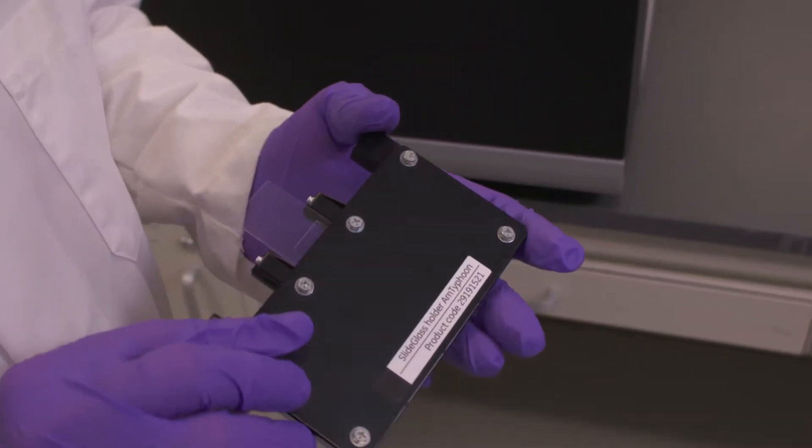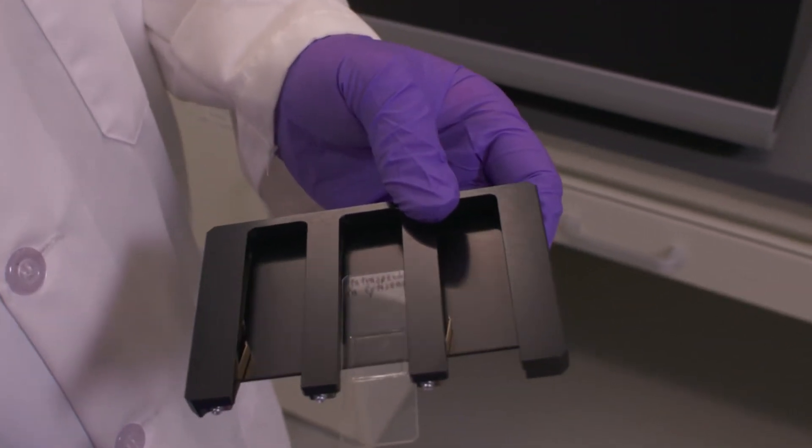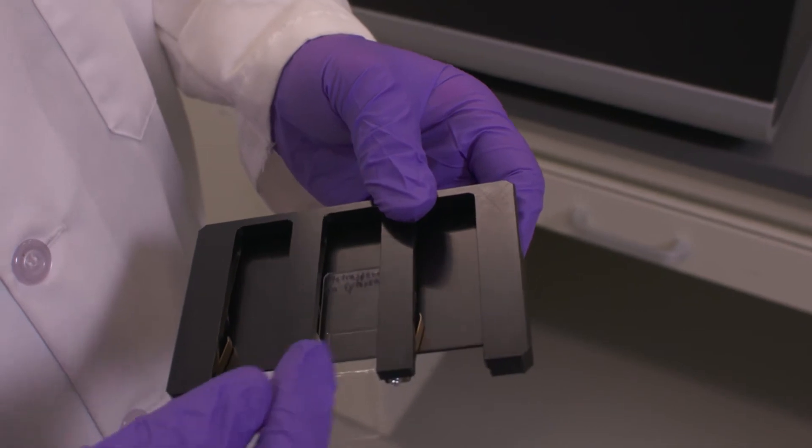We're going to use this accessory. It's called the Glass Slide Holder Amersham Typhoon. You'll see you can put up to three glass slides in here. Each one has a metal clip.